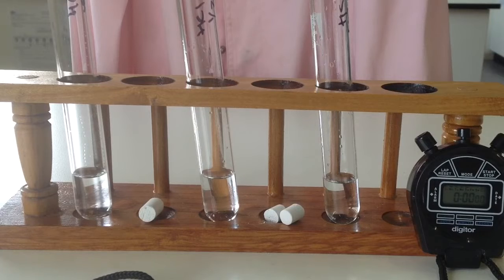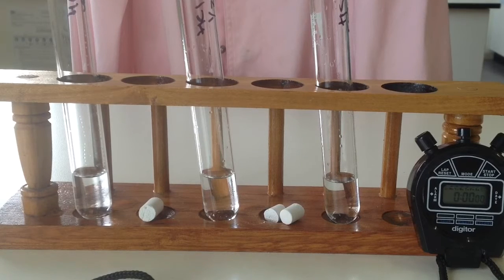Now, I didn't weigh the chalk. I just did it off size, so they're about 2 centimetres in length. But to improve this experiment, if you actually weighed the chalk and made sure the mass was exactly the same, that would be even better. And can you think of another way that you could make this experiment more reliable? All right, let's go. Let's see how we're going to go.